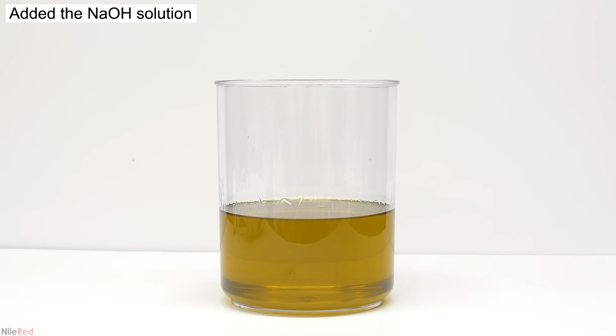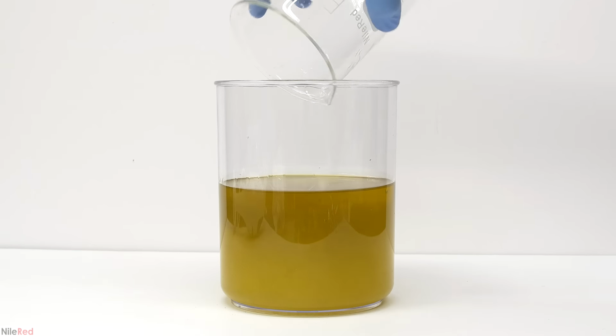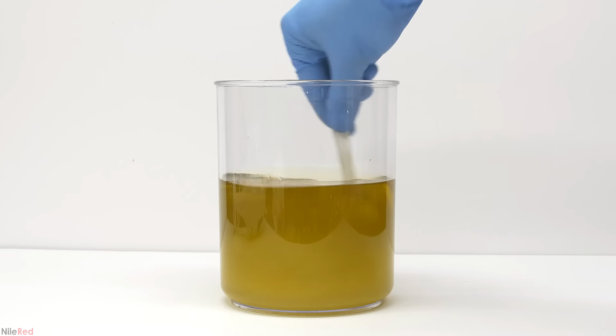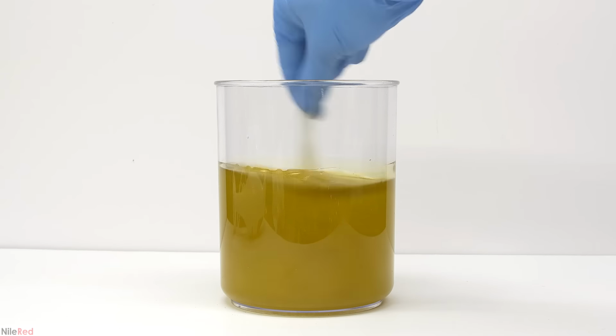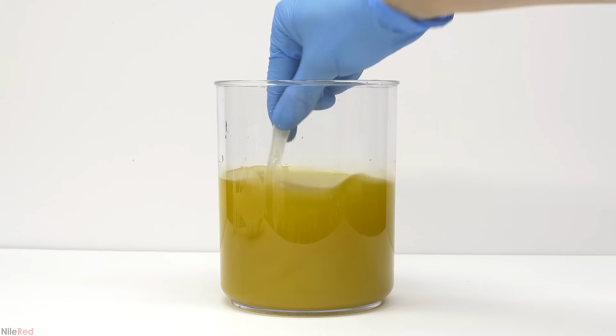To the mixture of oils, I add the sodium hydroxide solution from before. The moment it's added, we can already see some cloudiness, which is the beginning of the reaction. Using a spoon, I give it a quick mix, and then I continue things with a hand blender.